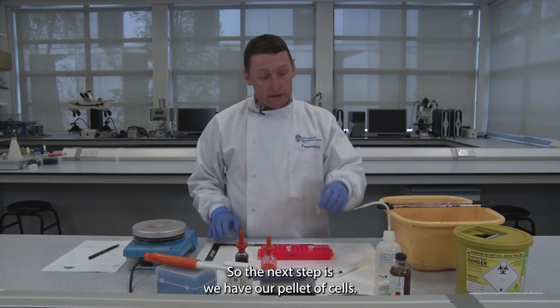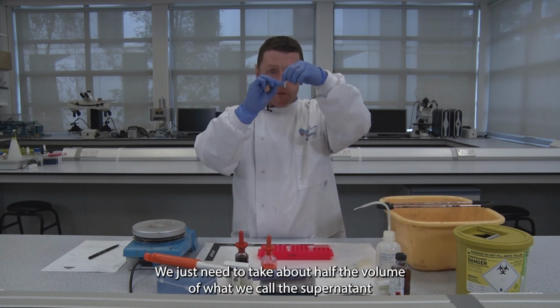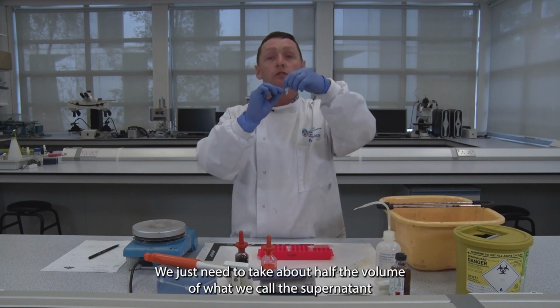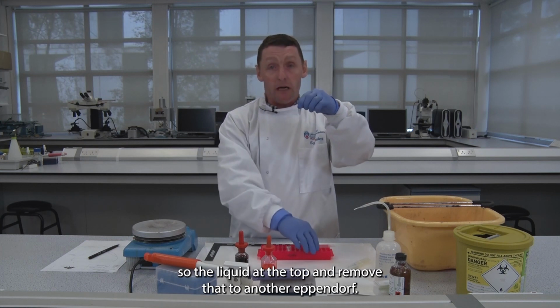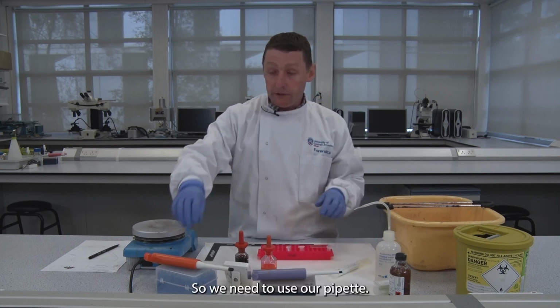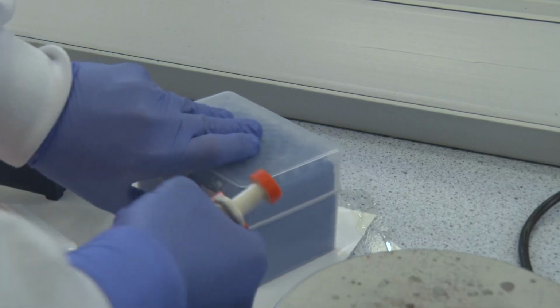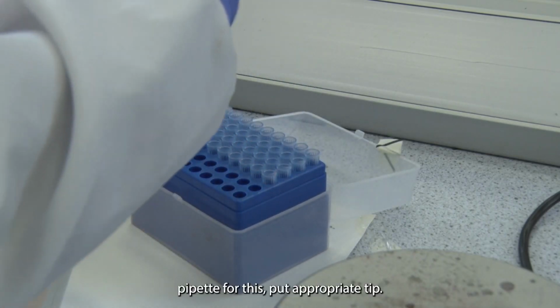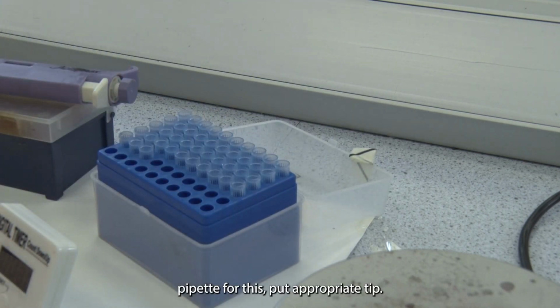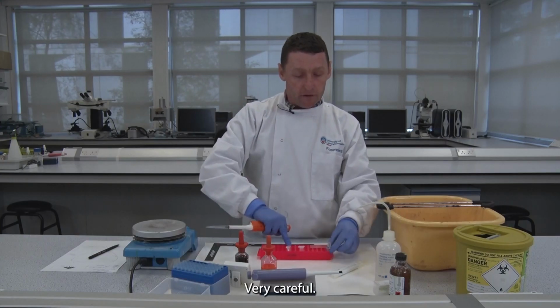So the next step is, we have our pellet of cells. We just need to take about half the volume of what we call the supernatant, so the liquid at the top, and remove that to another Eppendorf. So we need to use our pipettes. Open our pipette box. We use a P1000, which is a 1 ml pipette for this. Put the appropriate tip on. Very careful.